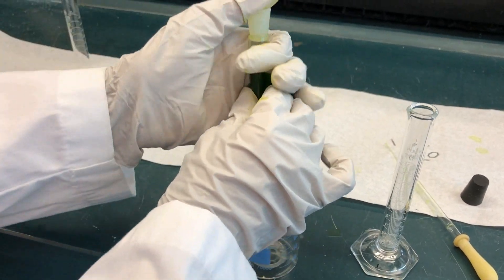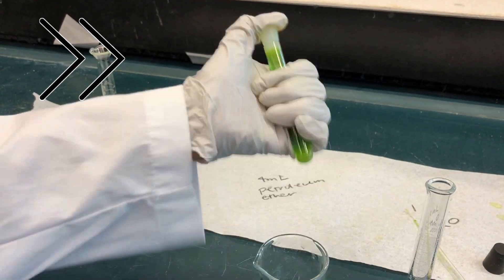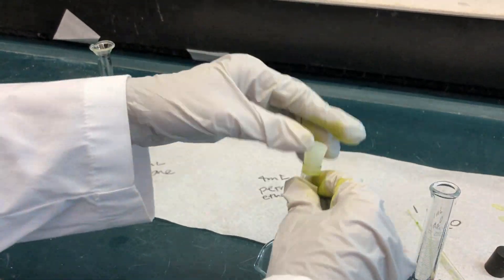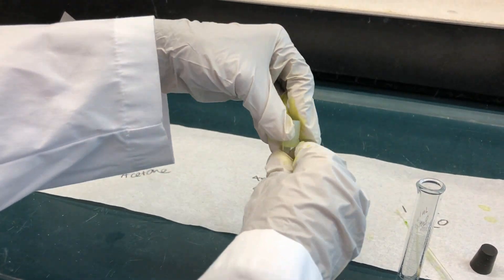The stopper tends to pop out at this step so hold it tightly with your thumb while shaking and occasionally remove the stopper to release pressure.